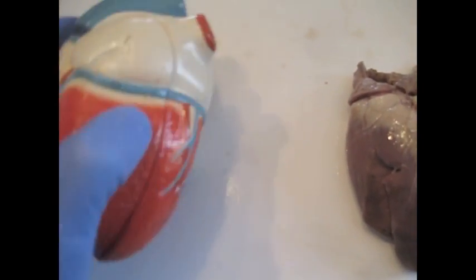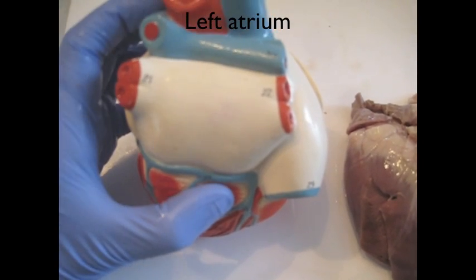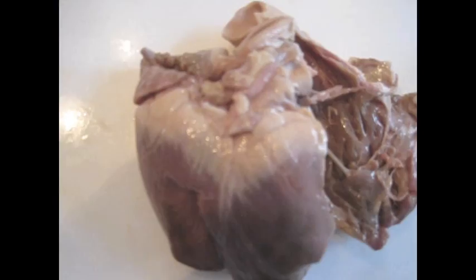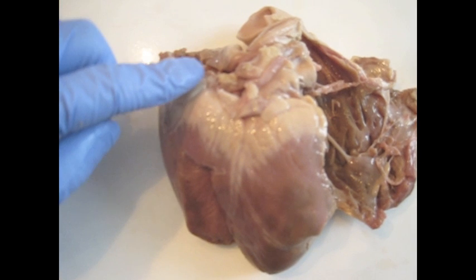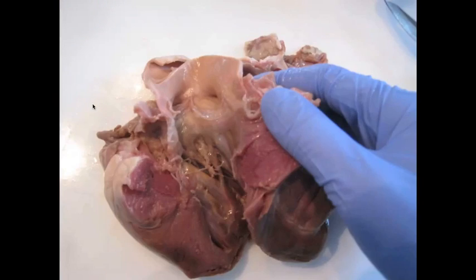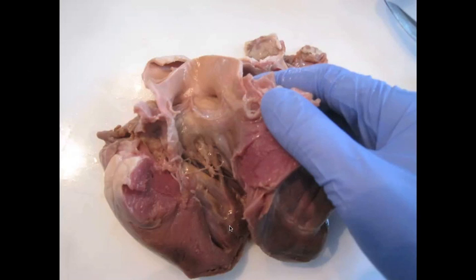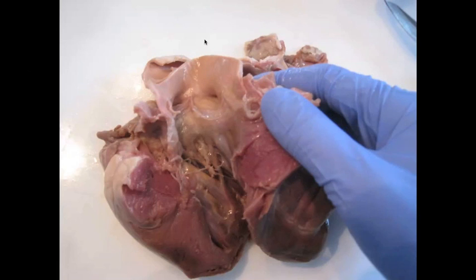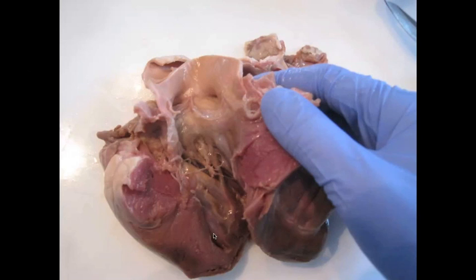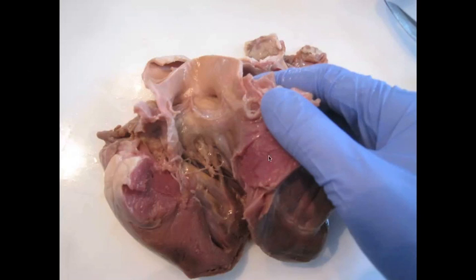Now we'll move on to the left side of the heart. Shown here are four relatively small pulmonary veins that enter the left atrium. Here is the auricle of the left atrium. I'll be making a cut through the left atrium down into the left ventricle. The left side of the heart has been opened up here. Blood would flow through the left atrium to the left ventricle and then up through the aorta. The myocardium is thick because we're looking at the left ventricle — it's a good indicator of whether you're looking at left or right ventricle.